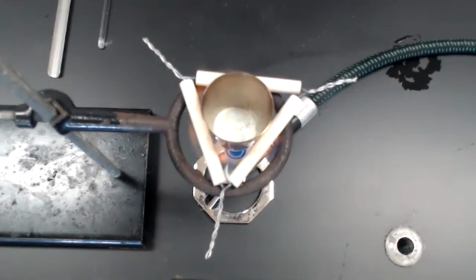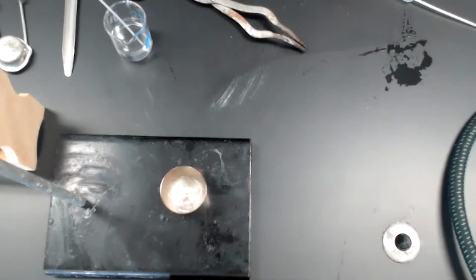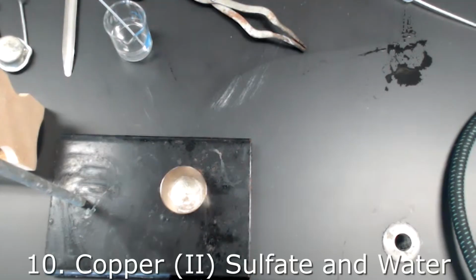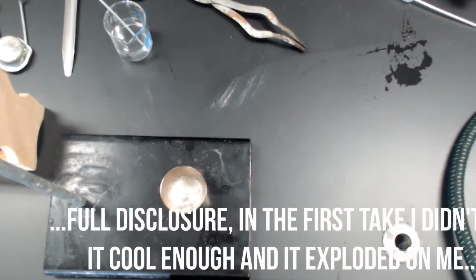At this point, I can turn my Bunsen burner off and allow the sample to cool. Was this change a physical change or a chemical change? Okay, our sample of copper 2 sulfate pentahydrate, which we evaporated, has now cooled. Okay, we are back. Our sample has now cooled sufficiently.